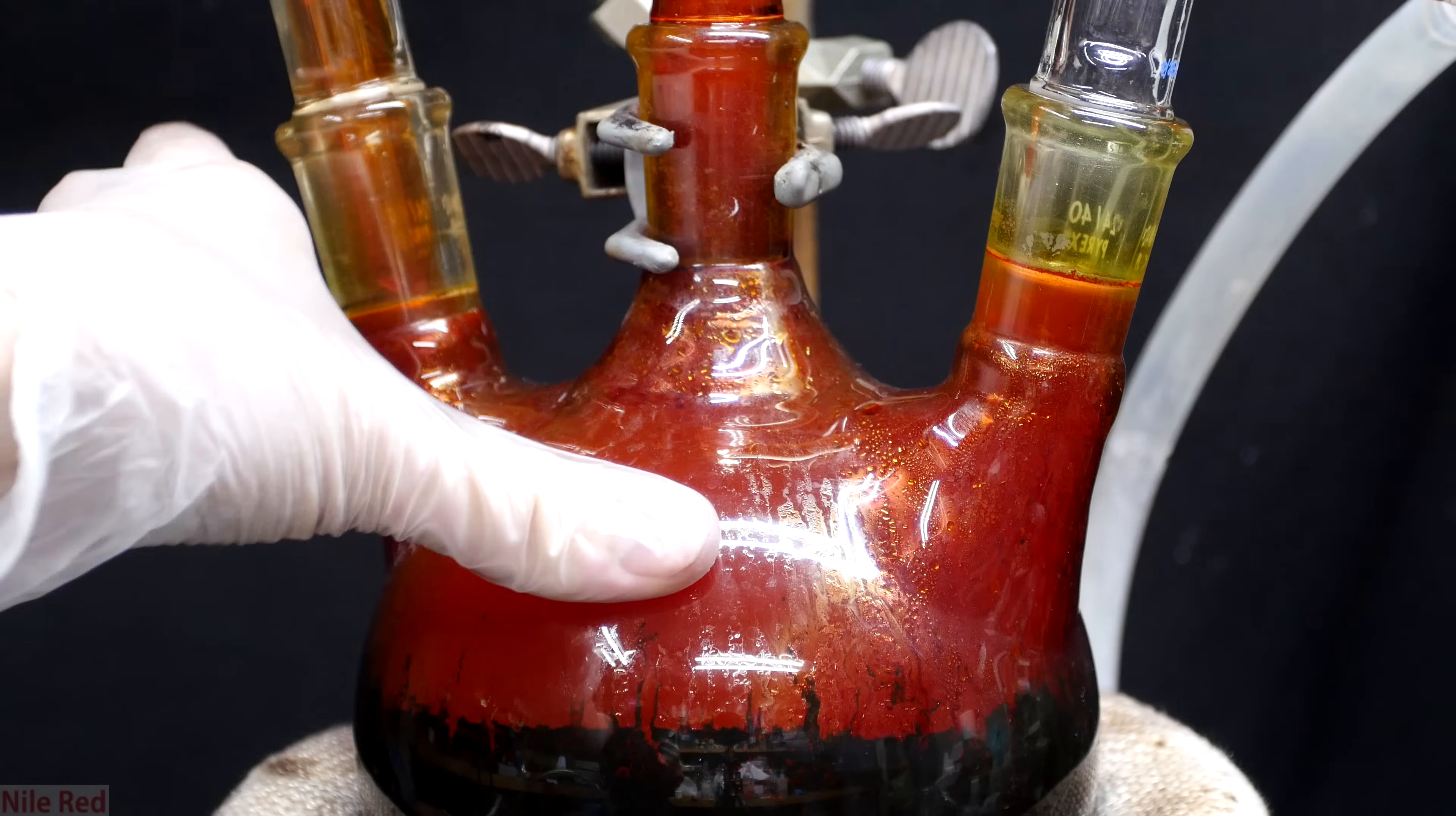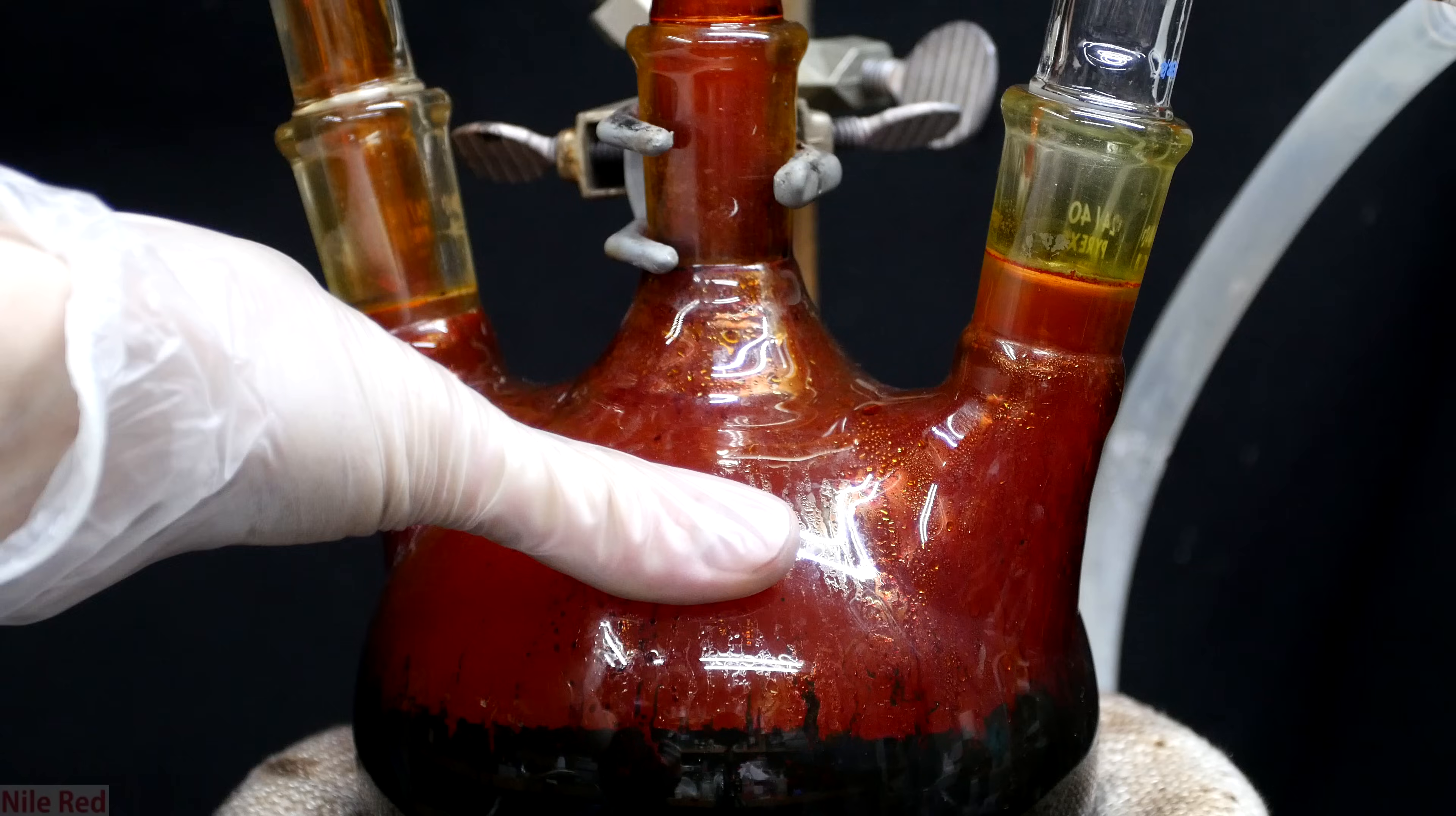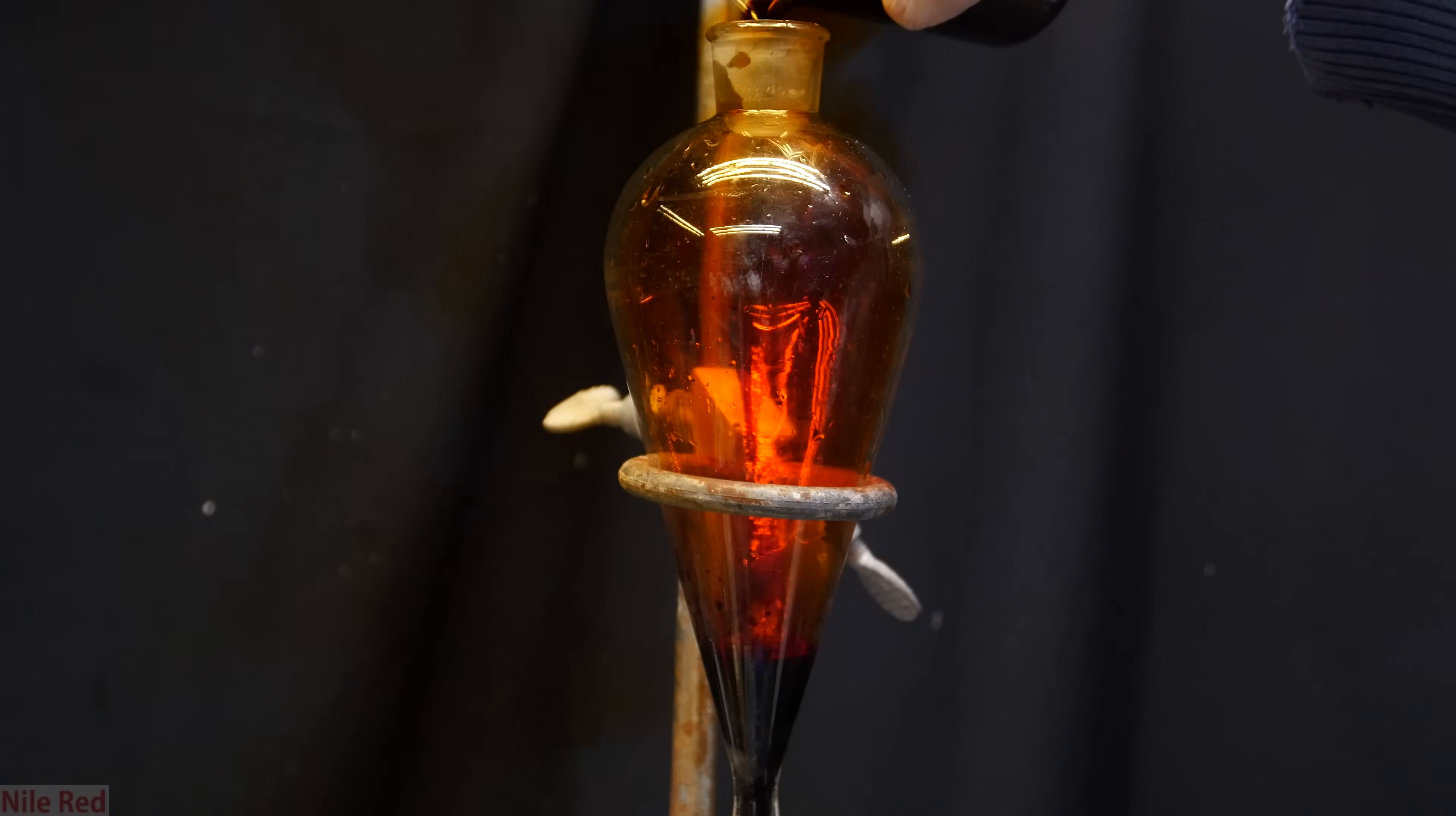It's a pretty useful chemical in organic chemistry, but in general, I want to make it because it's just a cool element. It's very dark red, almost black color, makes it look pretty scary. On top of this, it fumes a lot, and a lot of brownish orange fumes come off, which is also pretty cool.